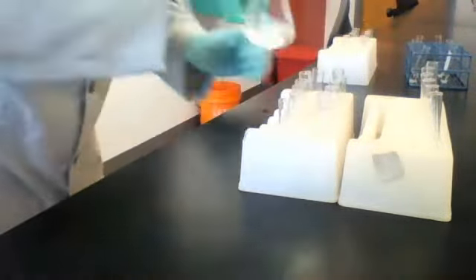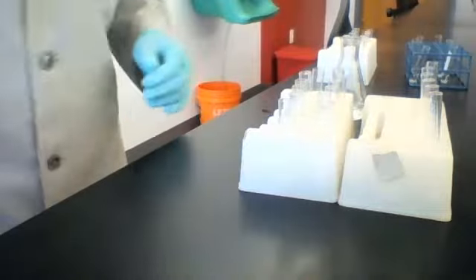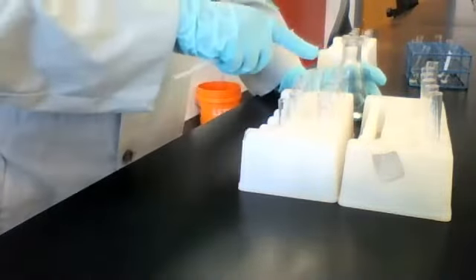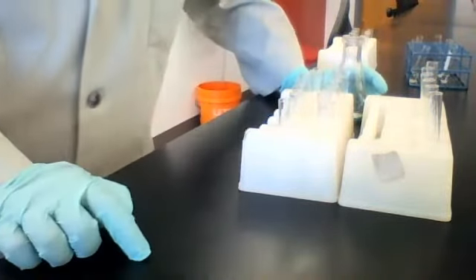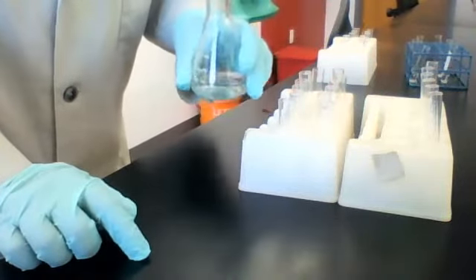If not, let's move on to our second reagent, which is sodium hydroxide. So we're going to go through those same 6 test solutions, but this time we're reacting them with sodium hydroxide.